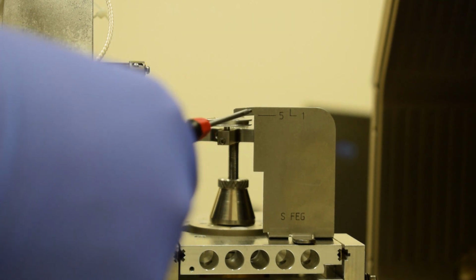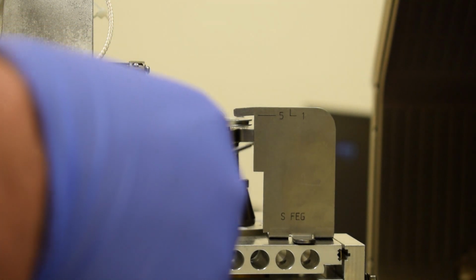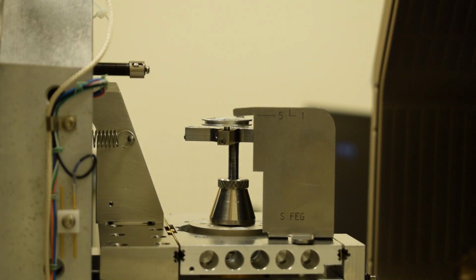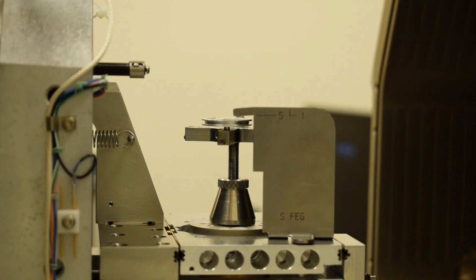Beyond those constraints, there isn't a very specific height that you need to load a sample on this microscope. Anywhere in this whole range is okay. Practically speaking, I like to aim for about 2 to 3 millimeters below the 5 line. I find that's a very useful distance to start at. It allows a lot of flexibility and allows a lot of safety when you close the door.